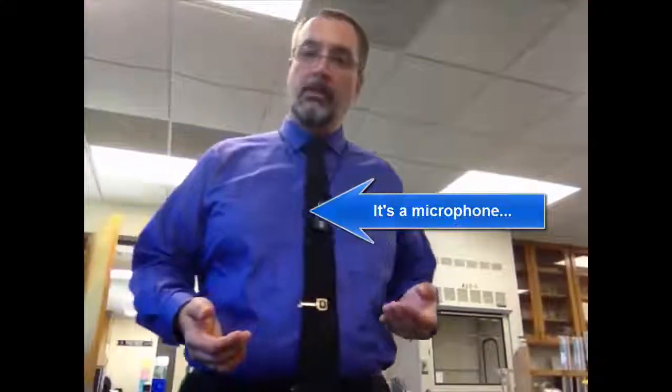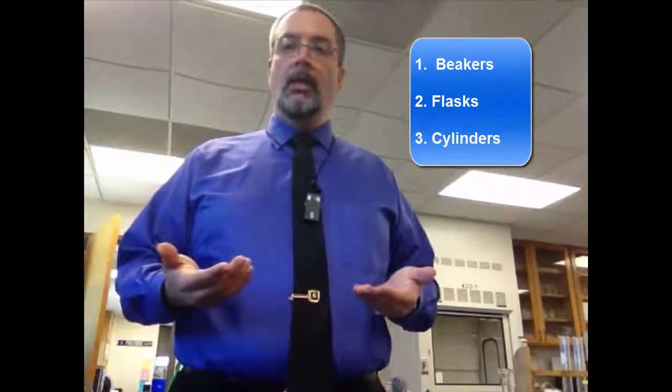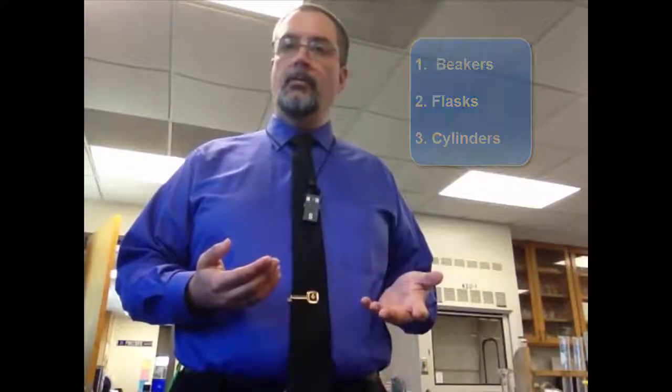We're going to start with some basic glassware. Now there are three general types of glassware that you're going to be coming in contact with: beakers, flasks, and cylinders. It's pretty simple actually. The way you tell the difference between them will also help you understand how they're used. So we'll start with beakers.